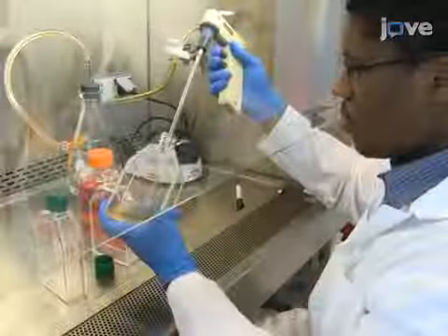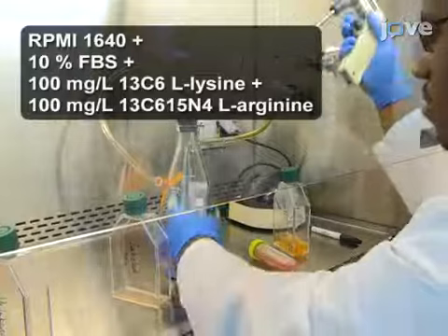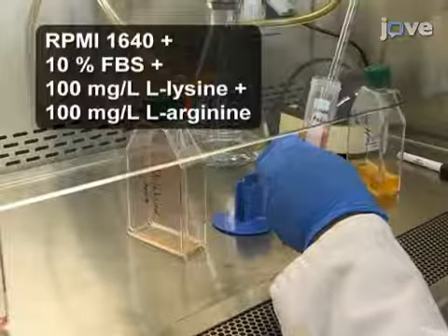Seed 2x10⁶ H9 cells into each of two cell culture flasks. Grow one population in 10 mL of labeled medium containing 10% dialyzed FBS, 100 mg per liter C13 labeled L-Lysine, and 100 mg per liter C13 and N15 labeled L-Arginine.